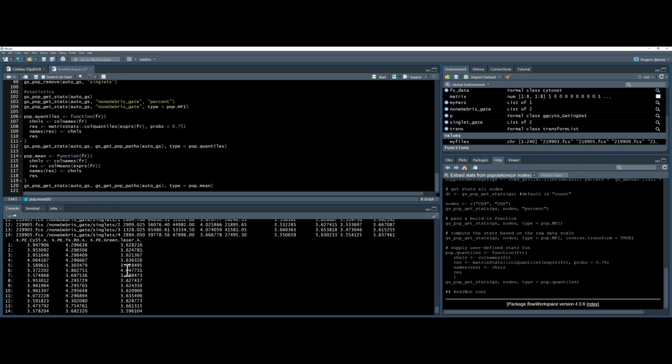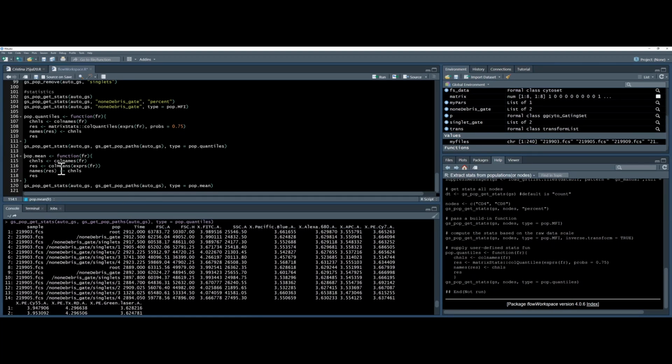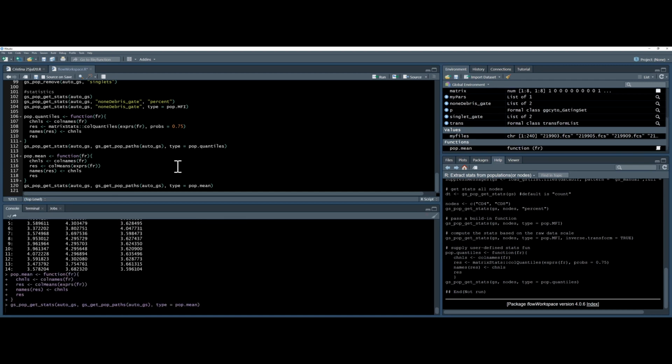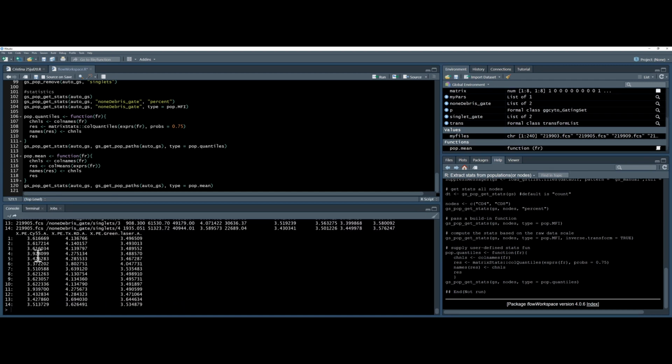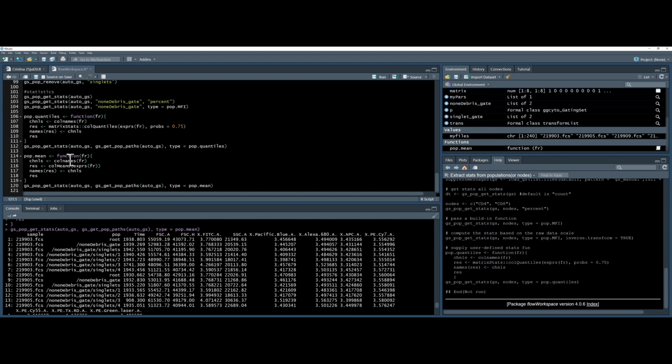One thing to be wary of is each parameter is a different column. So if you want to make your own function, for example, I've made one here for means. If you were unaware of this, you would probably just use the mean command, but this will just produce a mean of all the data. So that's all the data in every single column producing one number, and you would get an error in this case. What you actually want is the colMeans command, because then it does a mean of each column. So that's a new population means function, and now I can get the mean of each of these. If you want to do things like geometric mean, these all exist in R already, and you can just make a new function using this command.